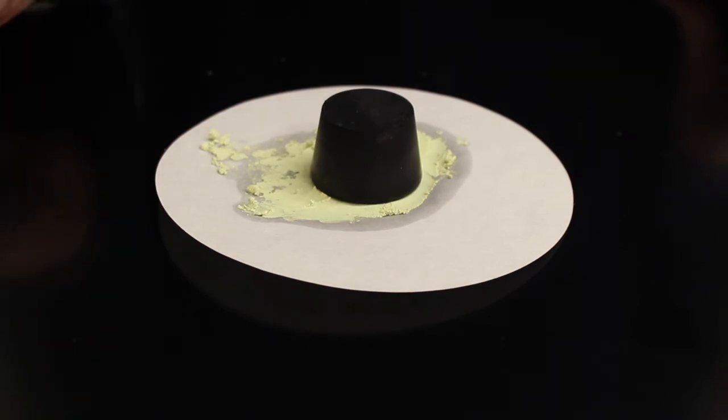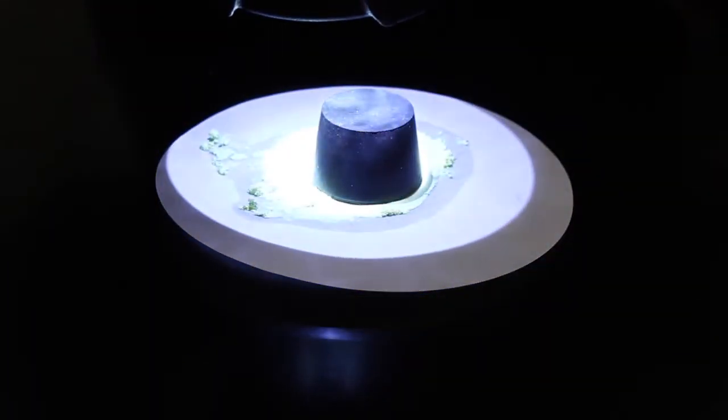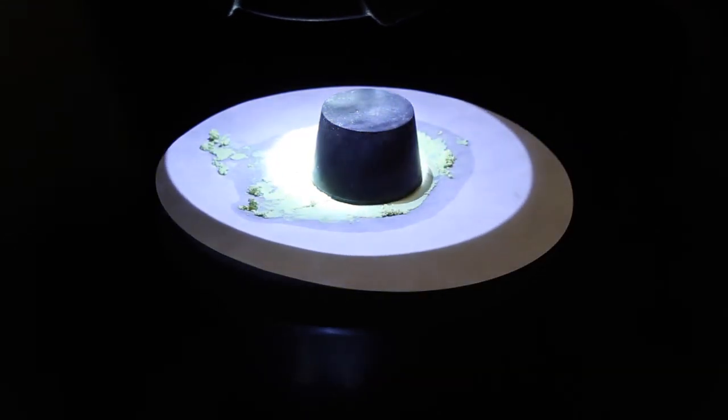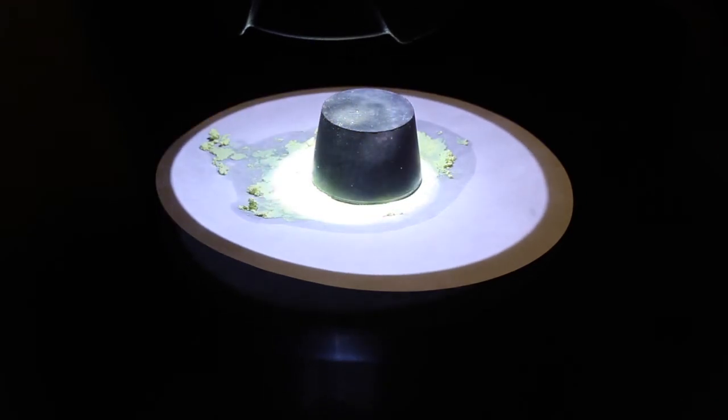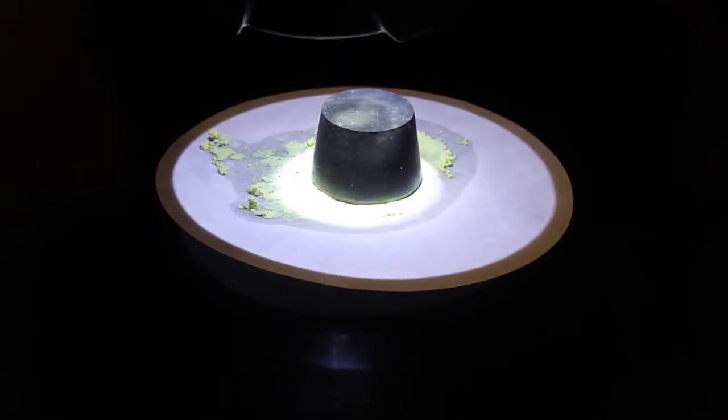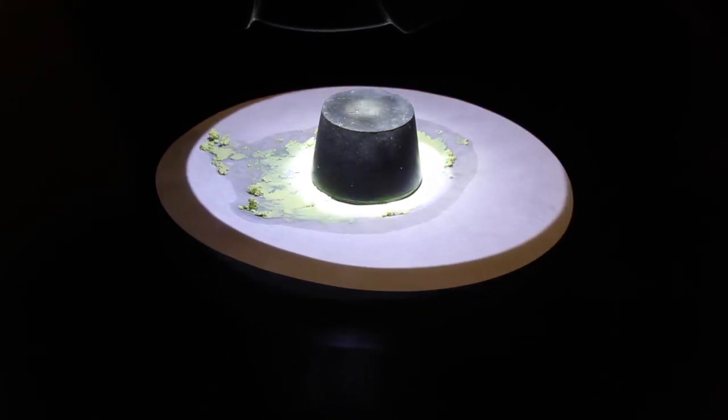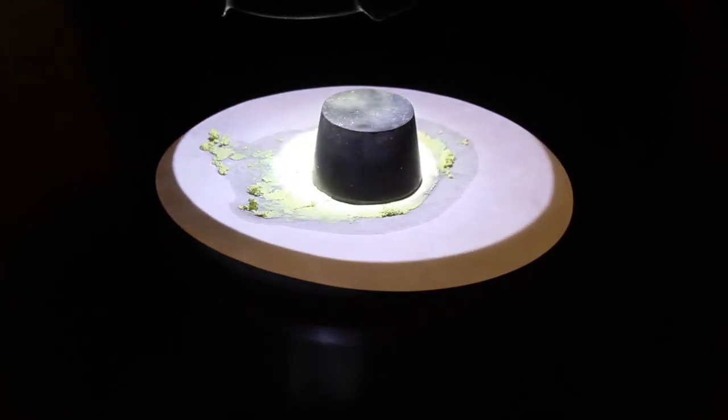The light is causing a redox reaction as the silver in the silver bromide is undergoing reduction. It starts off as Ag plus and is reduced to Ag zero or silver in the solid state.